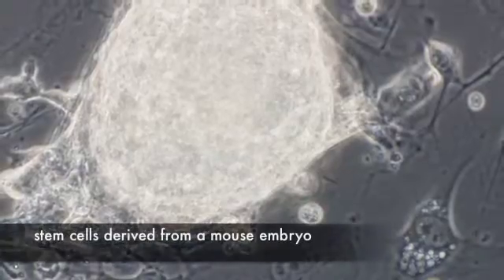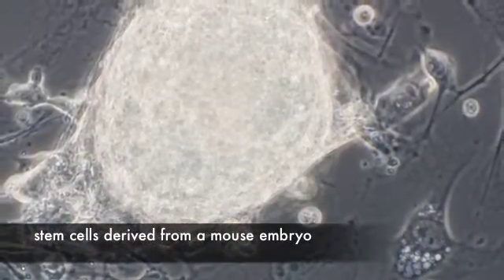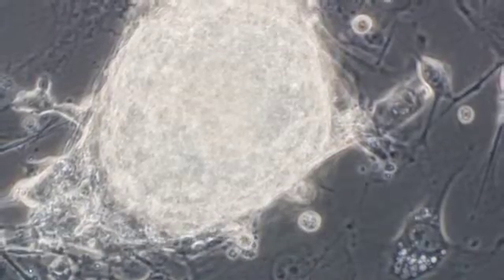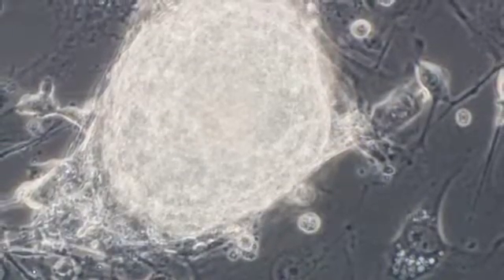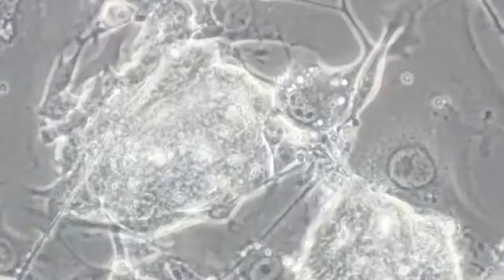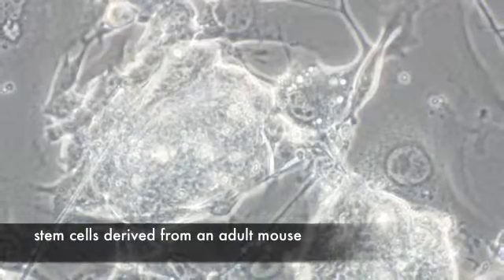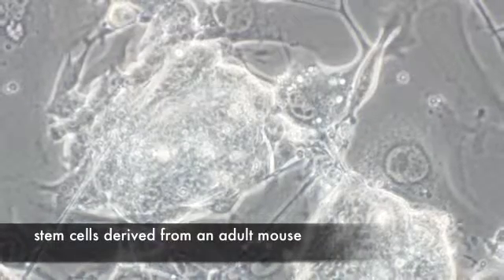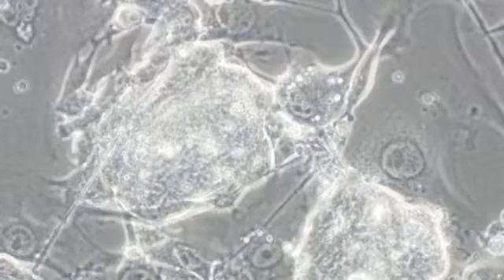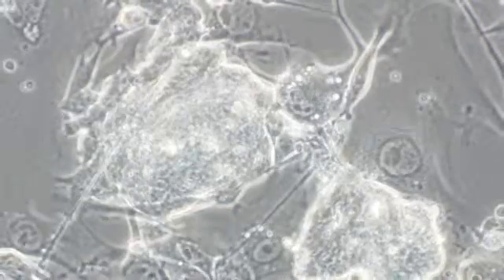Shown here is a colony of several hundred small, round stem cells derived from a mouse embryo using traditional techniques. And here is a colony of stem cells derived from the tail of an adult mouse using Yamanaka's technique. Notice the nearly identical appearance of these cells.